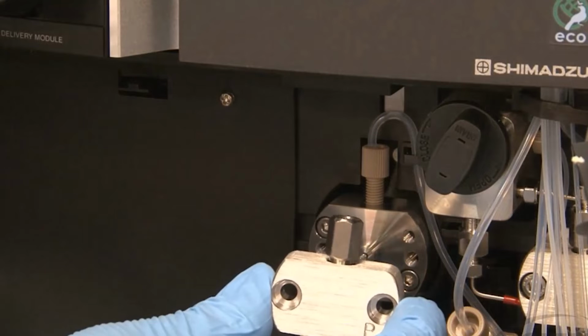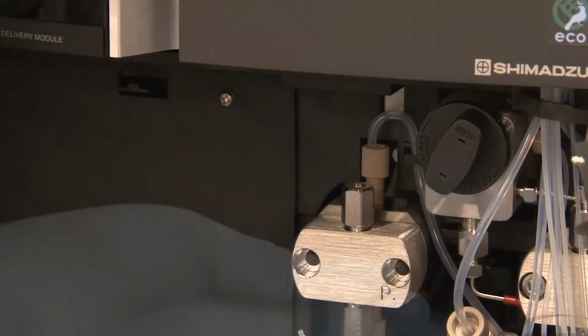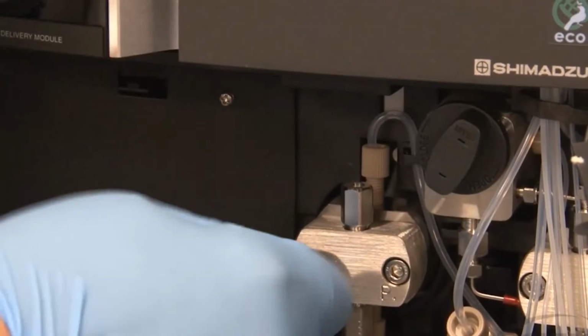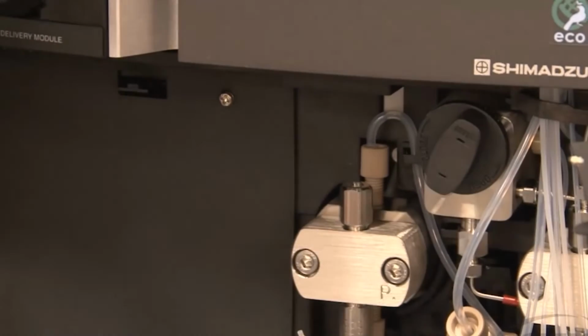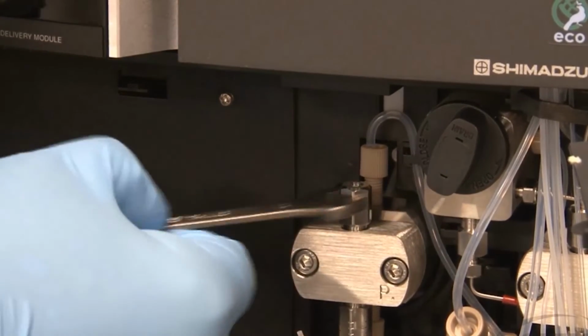Position the pump head holder with the stamped mark on the bottom right. Replace the screws holding the pump head to the holder and tighten them alternately. Tighten both of the check valves using a 10mm wrench.